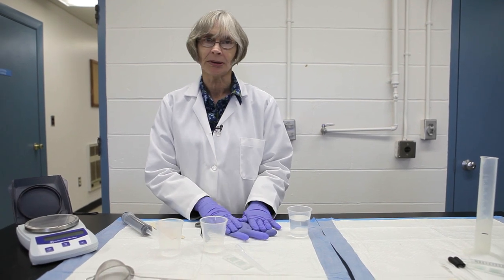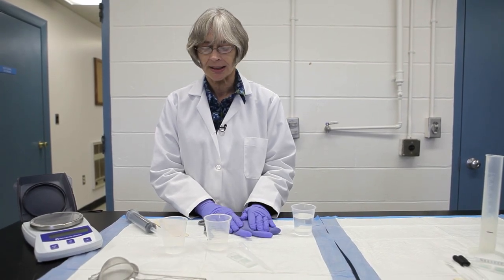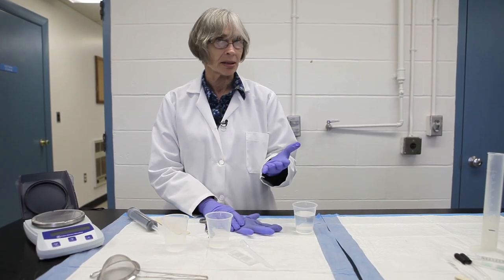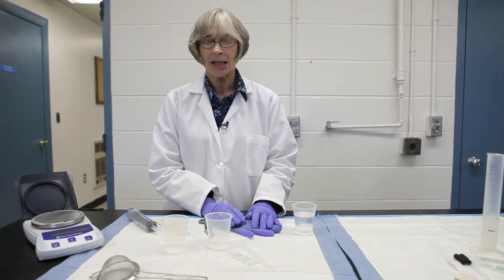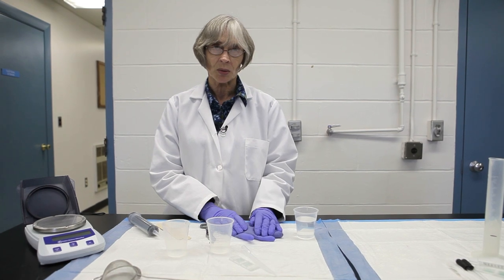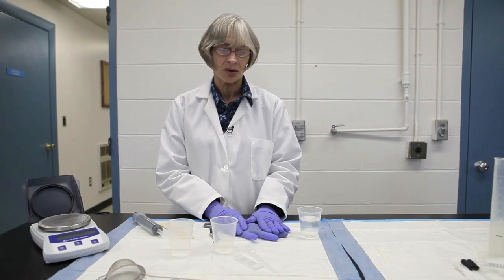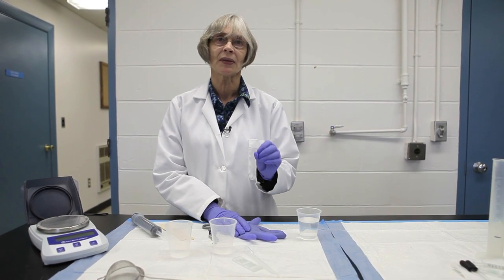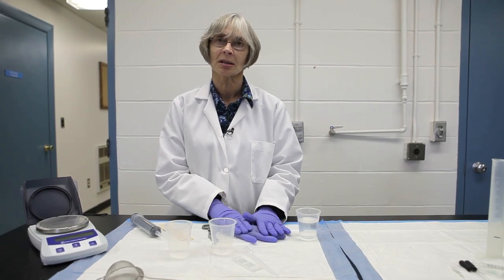Now you have your fecal sample and all the supplies needed to perform the McMaster test. I'm going to demonstrate the steps of the test. I'll show you the way I do them — if you check around the internet or talk to other parasitologists, you may find slight variations, and that's perfectly okay. There's no particularly right or wrong way to do them. The critical thing is to always do it in exactly the same way, because you'll only be able to compare results from animal to animal or time to time if you've done the test consistently.